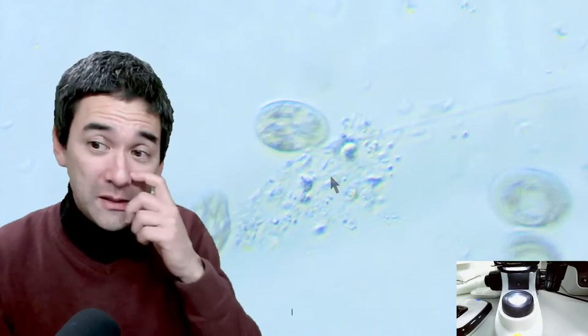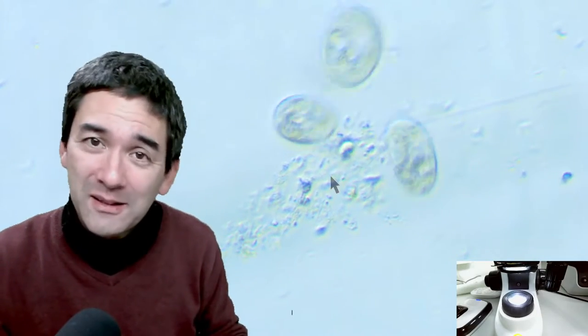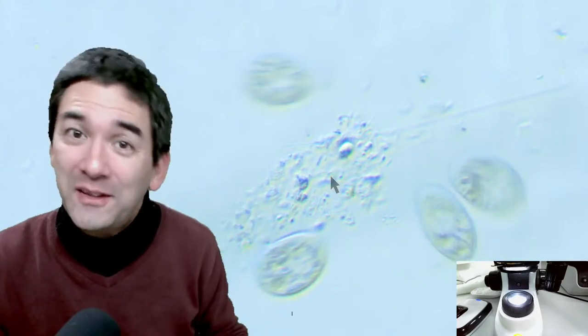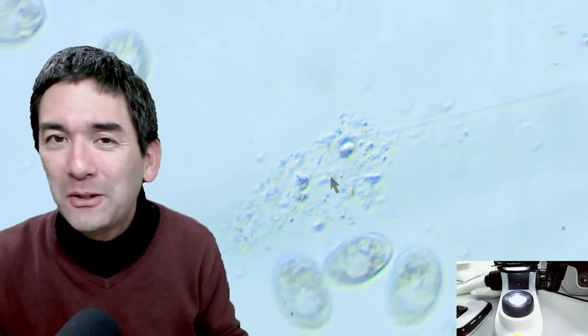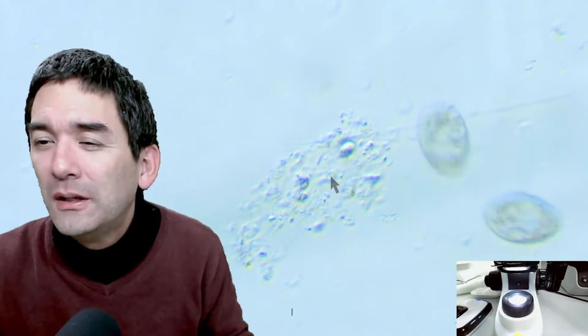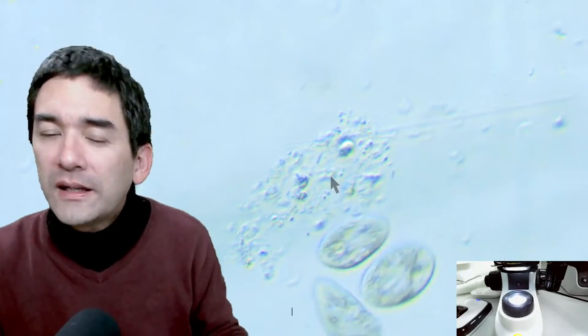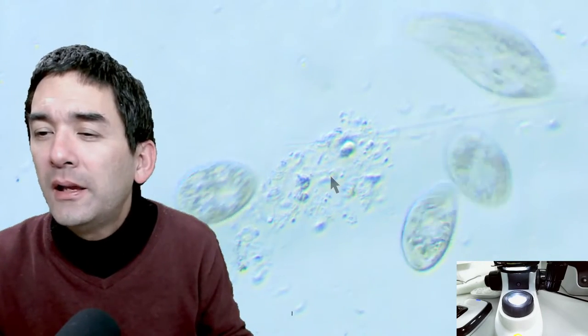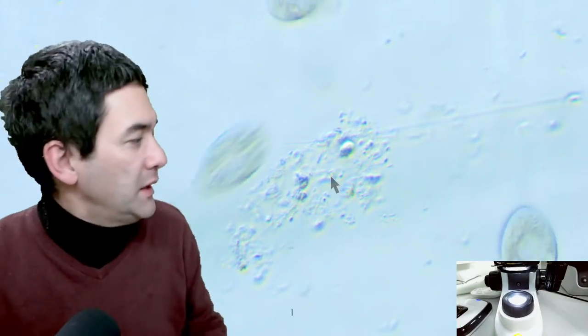How do you count or estimate the amount of microbes in a sample? You need to use a counting chamber. How do you make permanent slides of diatoms? Diatom preparation is a bit lengthy — you use hydrogen peroxide to remove all organic material, and you must use a mounting medium of the correct refractive index to see the proper structure of the diatom frustules. It's elaborate but not impossible. One disadvantage of oblique illumination is that it shows chromatic aberrations — color fringes.